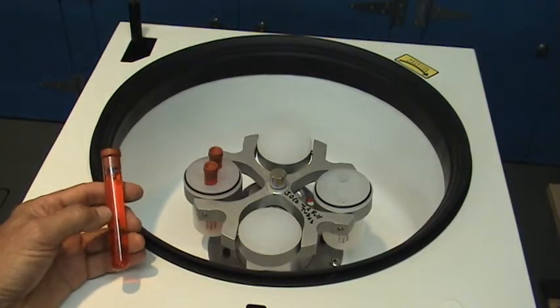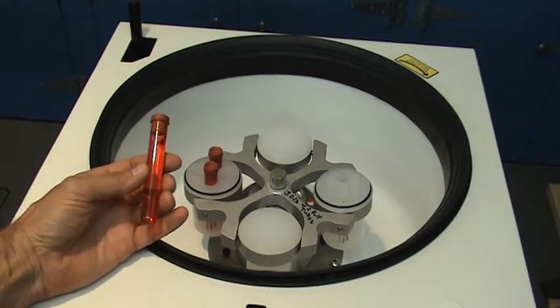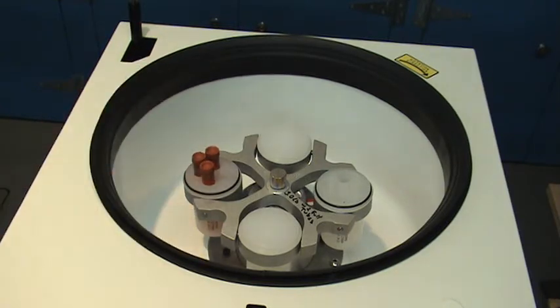Operating this centrifuge with 3 or even 4 full specimen tubes would seem to be ludicrous, and in fact the machine does have difficulty transitioning from the center of geometry to the center of mass, but you'll see that once the transition occurs, the operation is completely smooth.